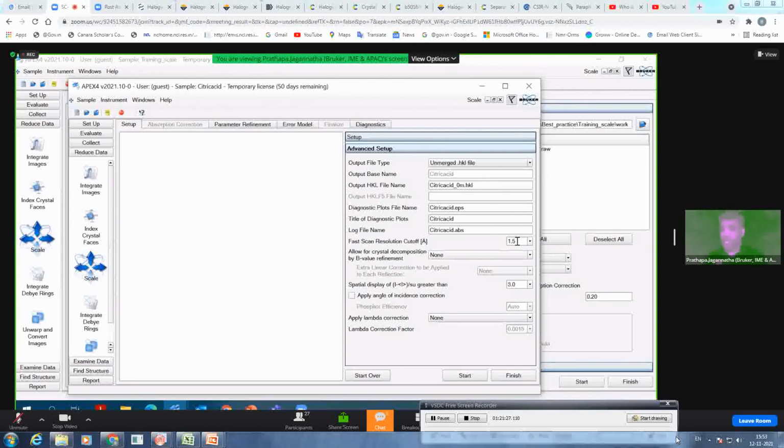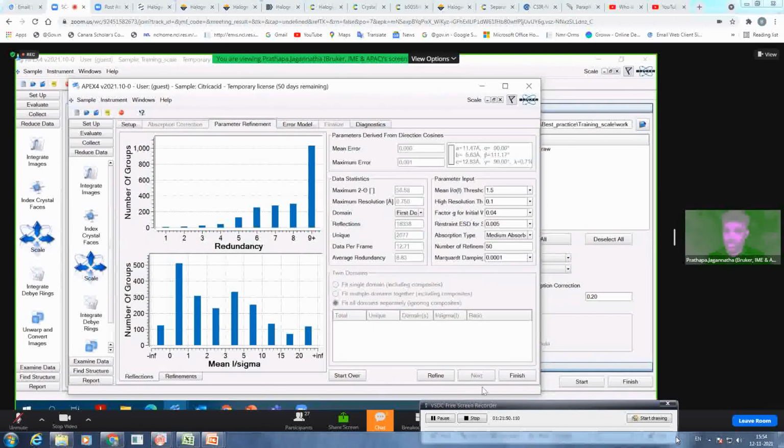You know, always the fast scan you have done with 1 second or even half a second. So the resolution will be generally poor. So that's why you want to use only the resolution up to 1.5. Sometimes you can use up to 1.2, no harm, but generally by default we kept it 1.5. So for a semi-automatic option, you have a finish button, but we want to go through step by step. I will click on start.